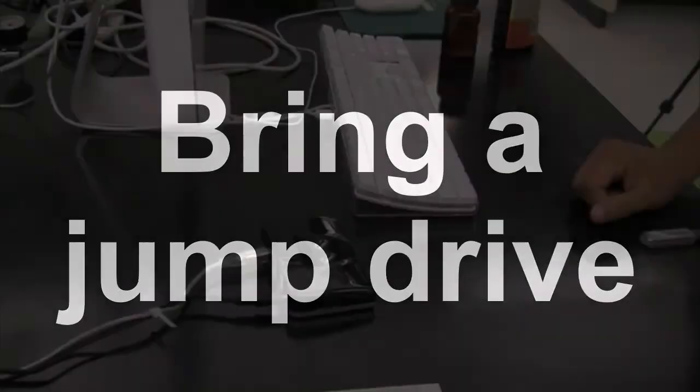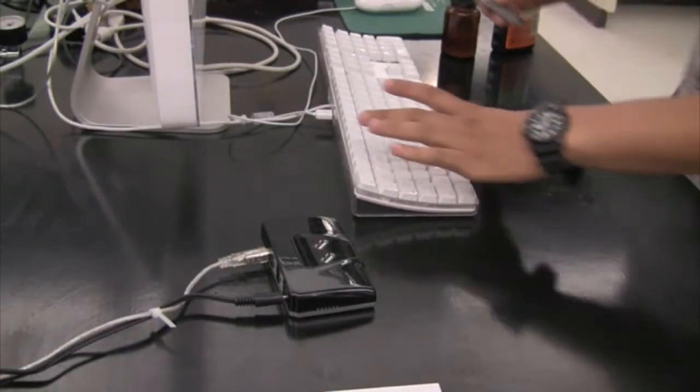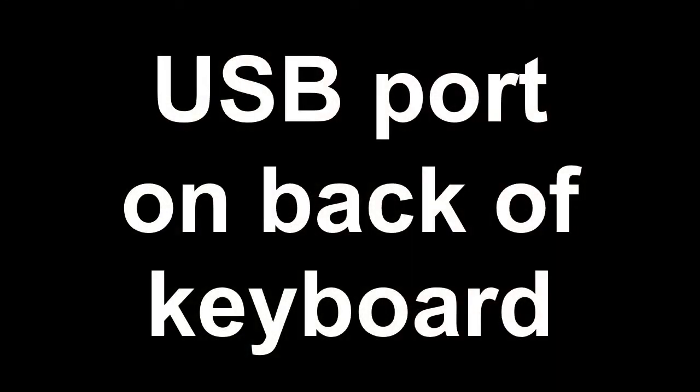You need to bring a jump drive to the lab so that you can save your data onto it and bring it home for your lab report. So, before you go to save your data, take your jump drive or USB key and insert it into one of the USB ports with the computer. Now, some of the computers might have a USB hub connected to them. If they do, you can use that. But if not, it's easy to find a USB port on a Macintosh computer. It's always located on the back of the keyboard.